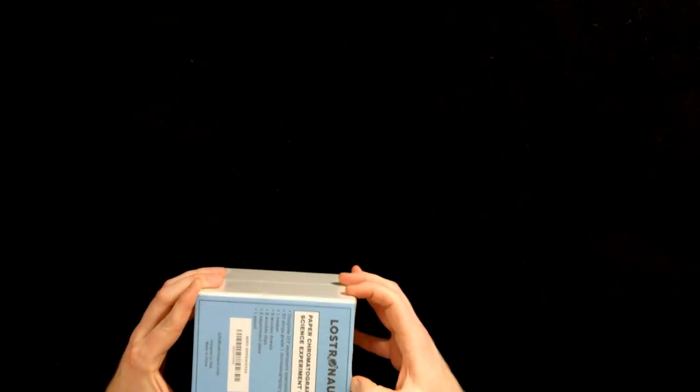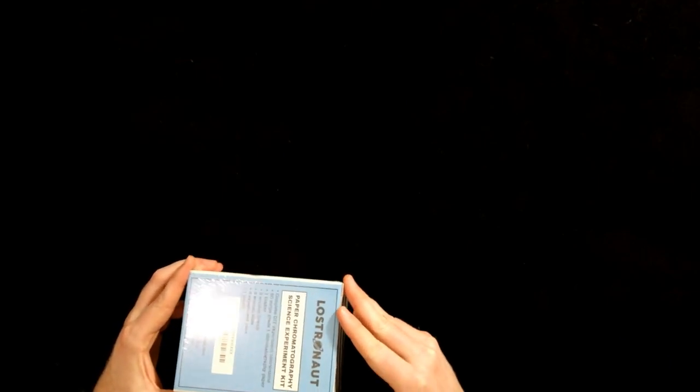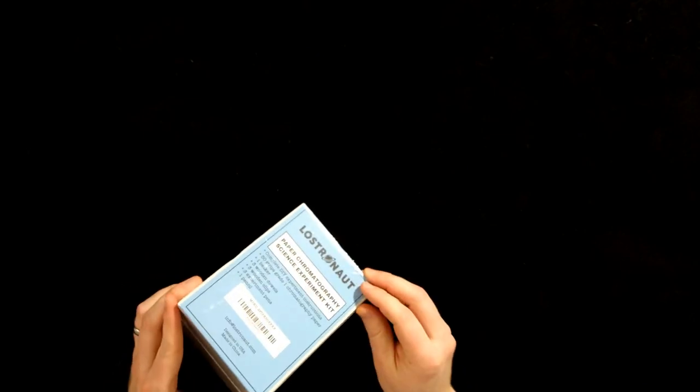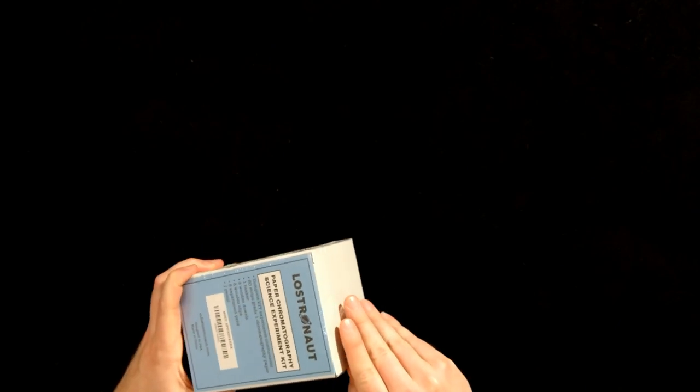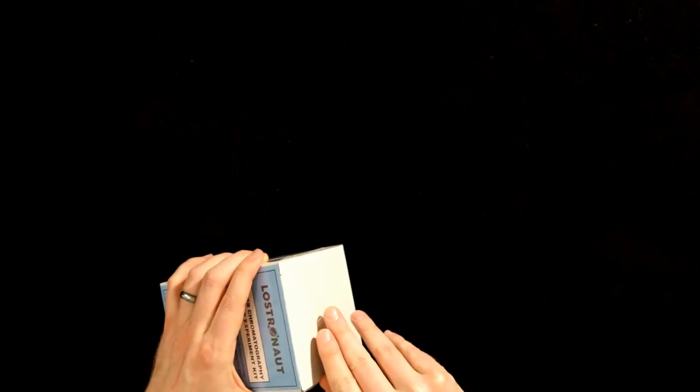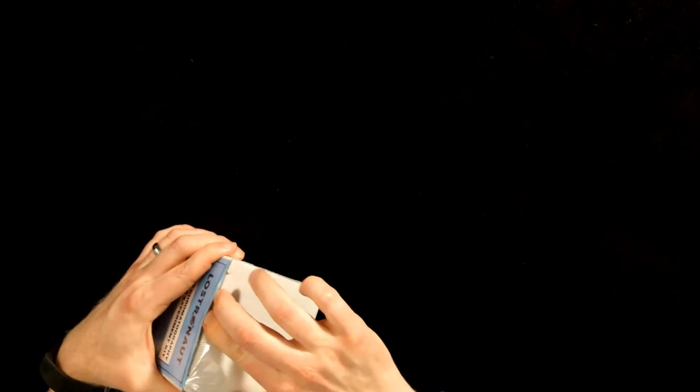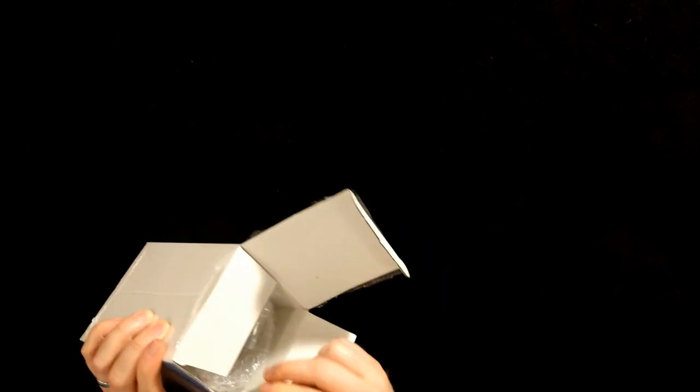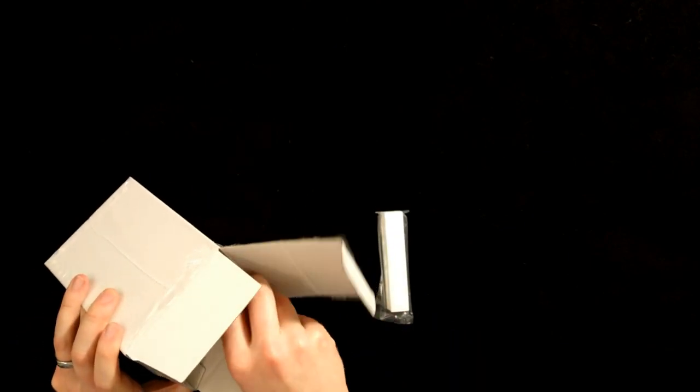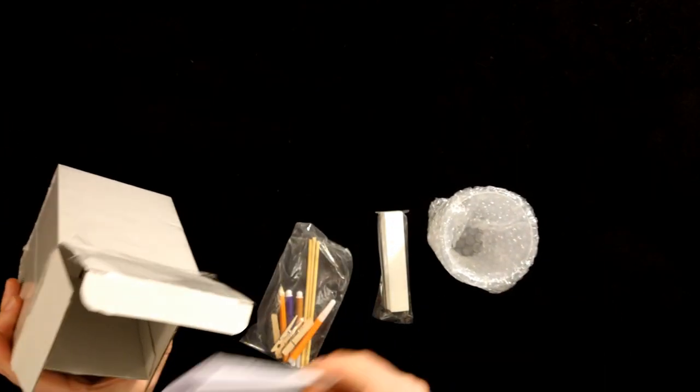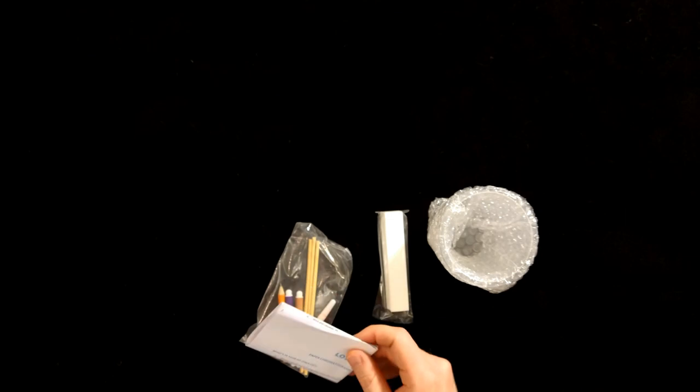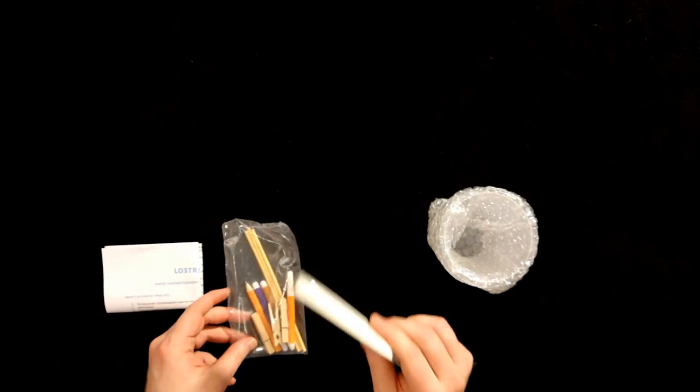Chromatography originates with paper chromatography, which is what we're going to demonstrate. I don't know how well this kit will actually do that, but we're going to find out. The origin of the term is chromatograph, so a color chromato and graph drawing, so a color drawing, but this predates color photography by a long shot. What we're going to do here is take an ink and separate it into its different colors, and these nice people provide instructions, ink which we can separate, and chromatography paper.